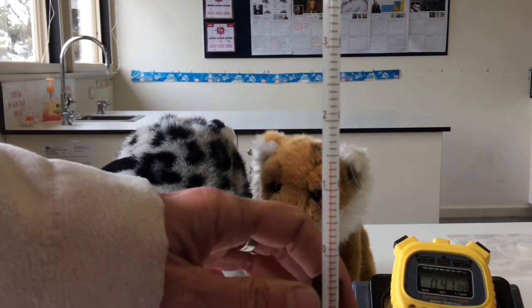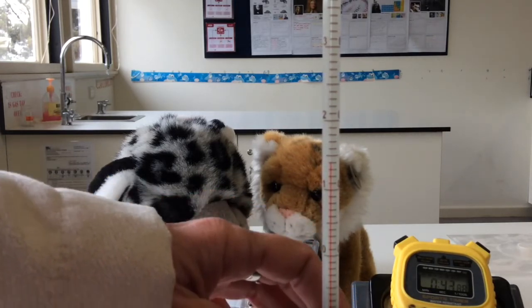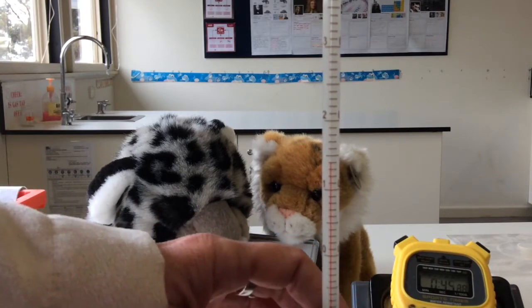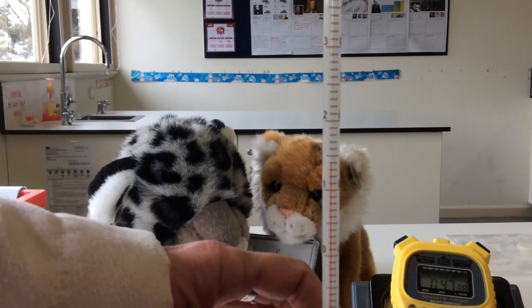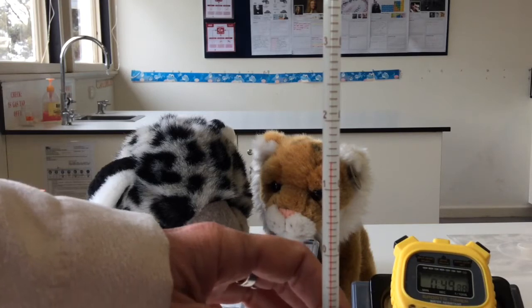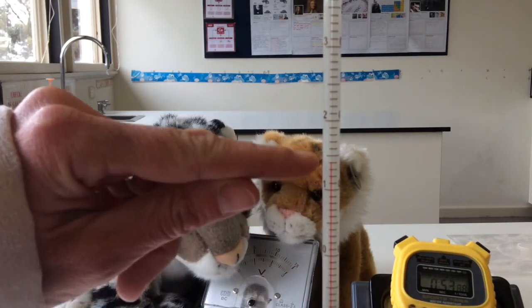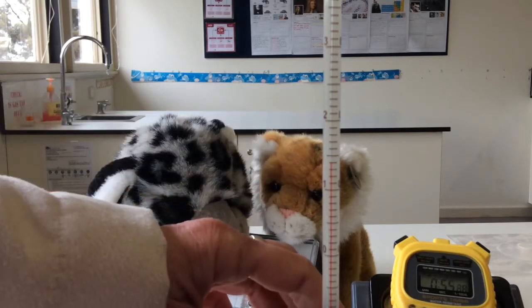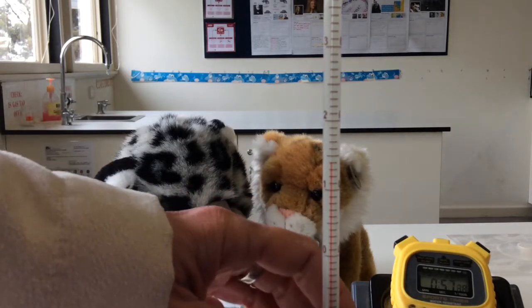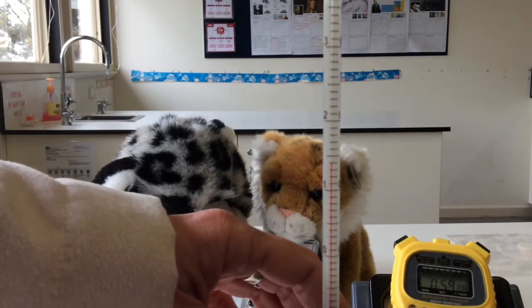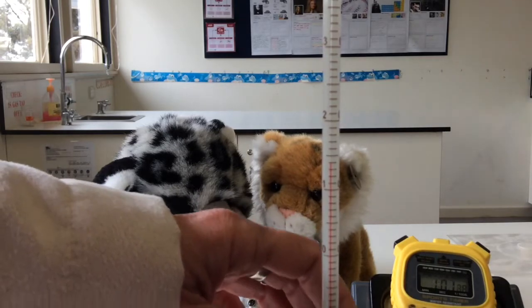After about three minutes, if I find that there's no difference or the temperature is not changing, it's at a constant temperature. So you can see the water's pretty cold at the moment. You've got that's 10 right there. So you can figure out the temperature. And a stopwatch. Hopefully, because it's a video, you'll be able to tell how much time has elapsed. But one minute has just gone.